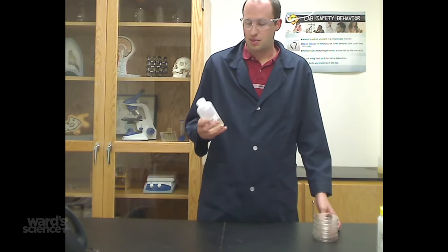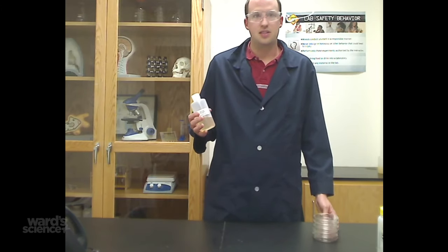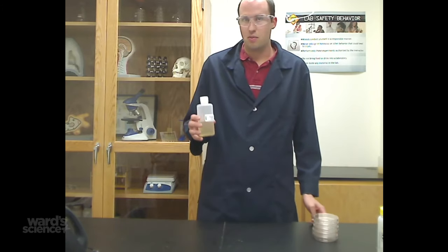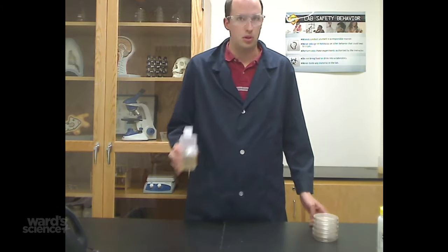Each bottle should pour approximately six to seven plates, because you'll be using about 17 to 25 milliliters of agar per plate.